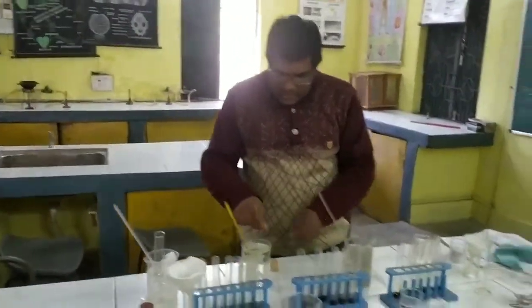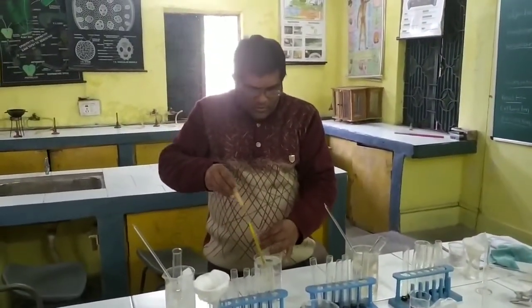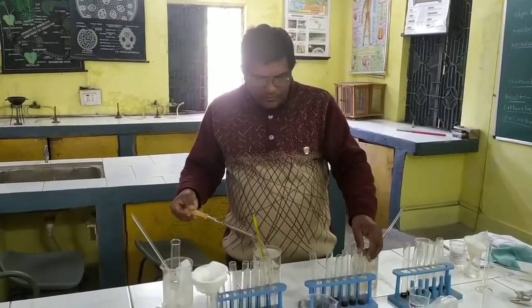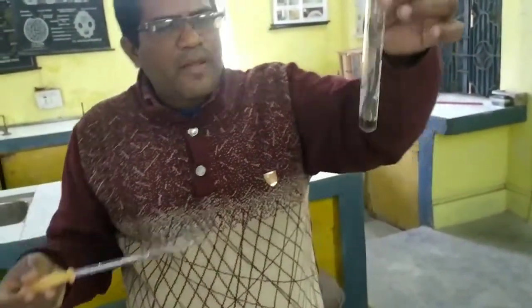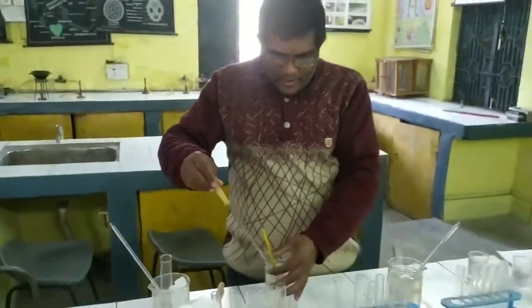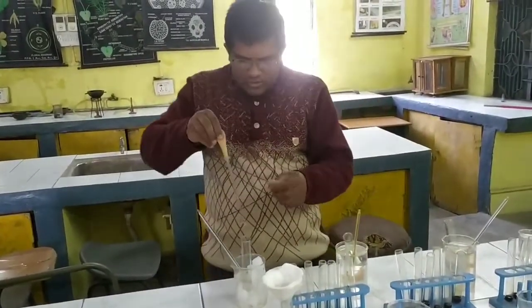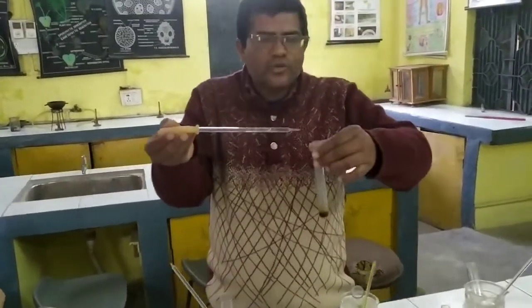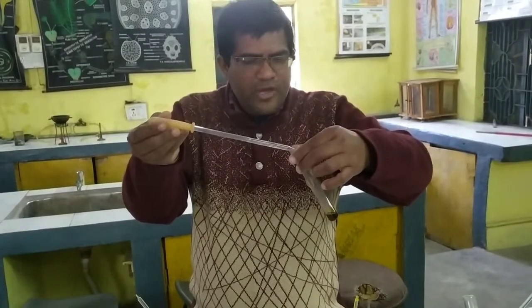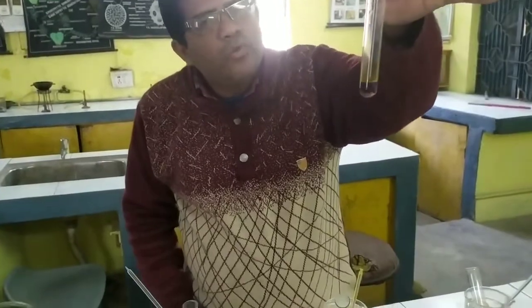Second, from the second test tube, we have to take some solution and pour it in this test tube. Here also, we have to keep a separate dropper and test. Here also the blue-black color comes. Then in the third experiment, I have to take the solution in the dropper and pour it in another test tube where iodine solution is there. Here also we are watching, and this solution has the blue-black color.